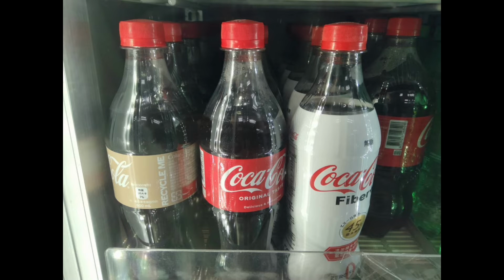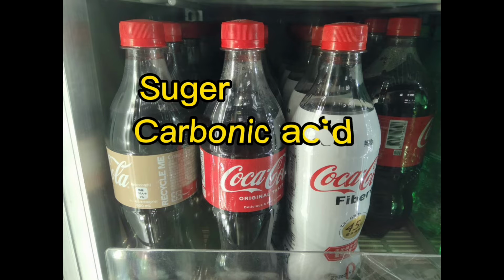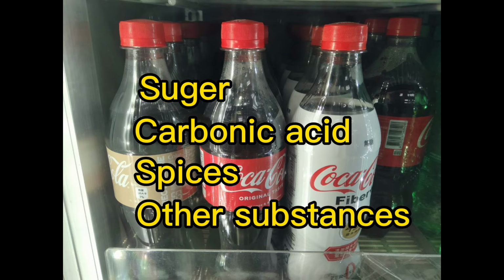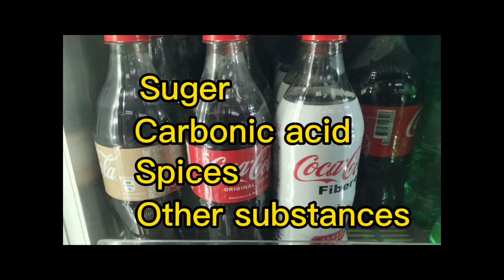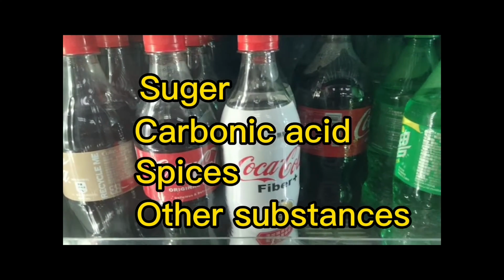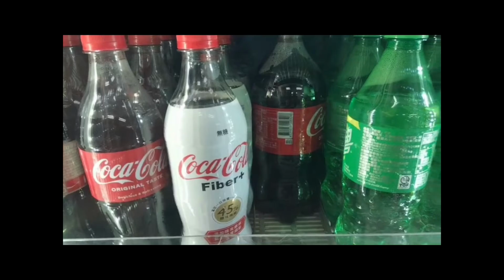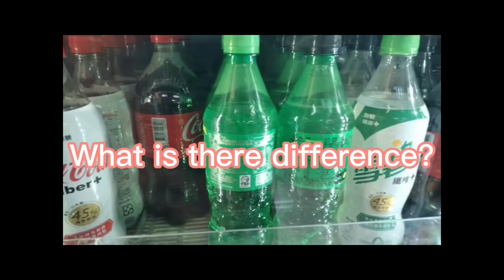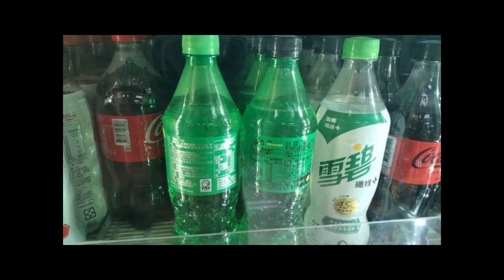Have you ever drunk Coke? Coke contains sugar, carbonic acid, spices, and other substances. It's one of the most popular drinks in summer. Have you ever thought about what is the difference between different brands of Coke besides the taste?